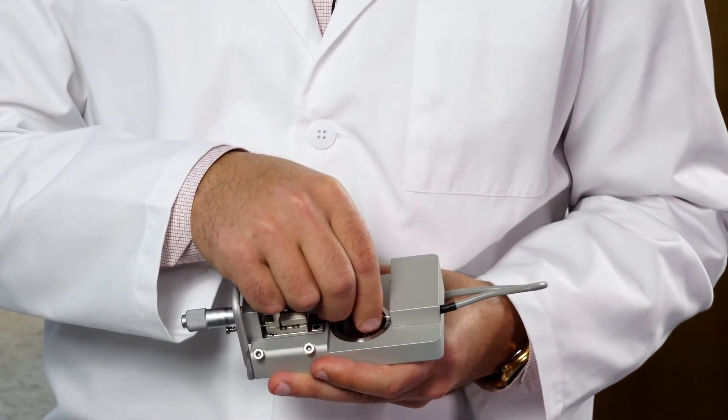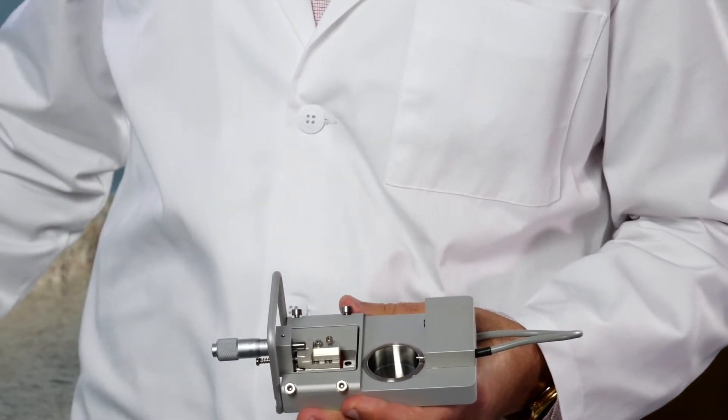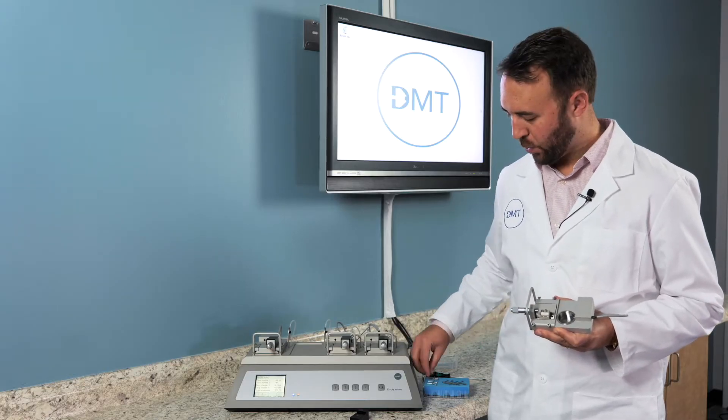And then you can slide this jaw off the transducer arm and set that aside. To replace the mounts, you will add the pins in the reverse order.